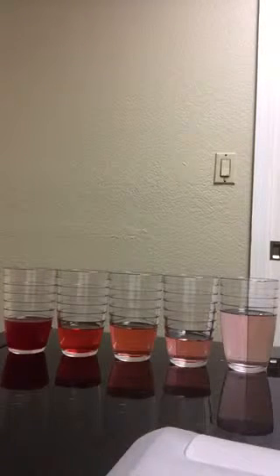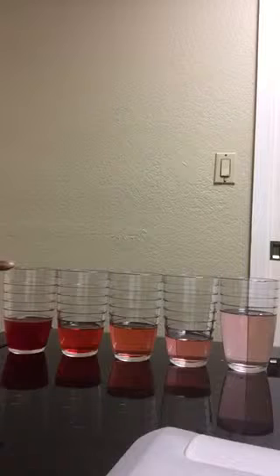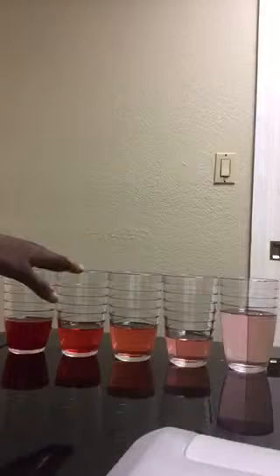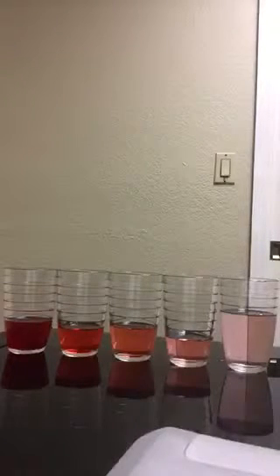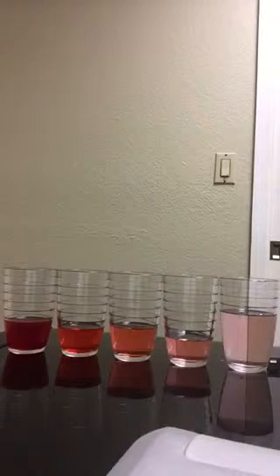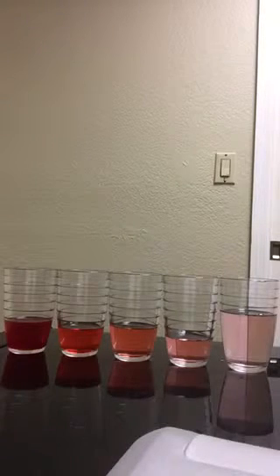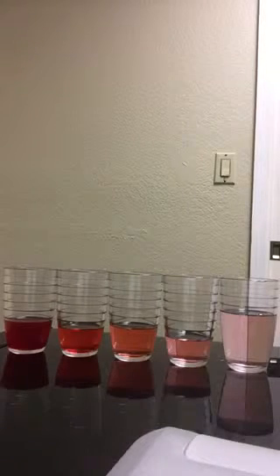So next, I transferred 25 milliliters from the mother solution into cup number 2. And then I added 150 milliliters of water into cup number 2. So the dilution equation for this would be 0.086, the molarity of the mother solution, multiplied by 25 milliliters, the amount transferred from the mother solution, divided by 175 milliliters, which is the total number of the solution after adding 25 milliliters of solution 1 as well as 150 milliliters of water. So after calculating that gave me 0.012, which serves as the molarity of solution number 2.